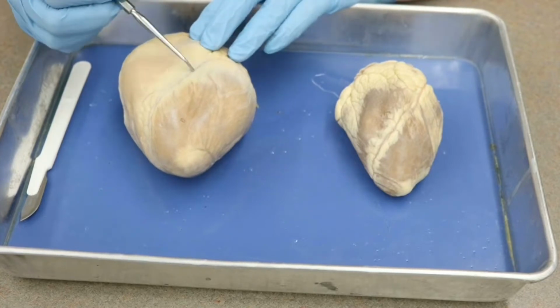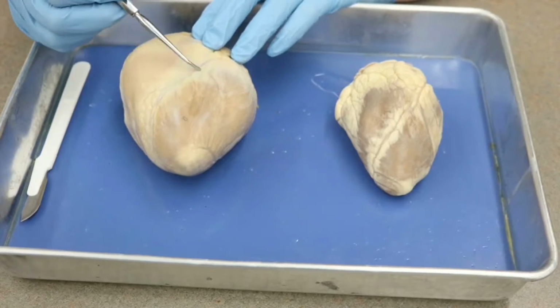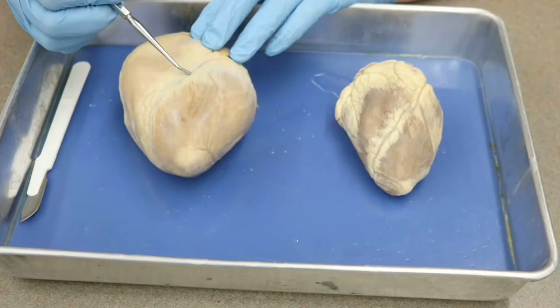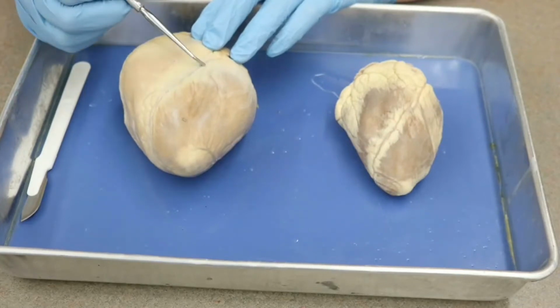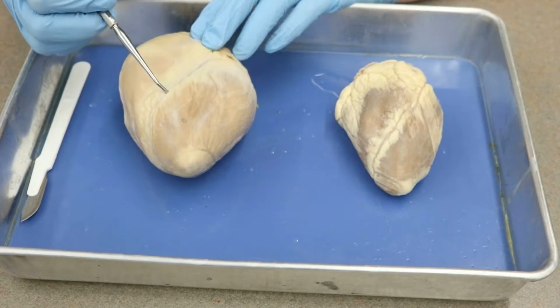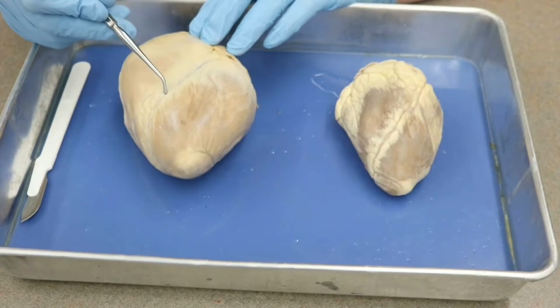We don't really need to know them for the dissected heart, merely because, well, they're not here. On a model, though, you would need to know the anterior interventricular artery and the anterior interventricular vein would be running around in this area. But if you're looking at a dissected specimen, this would just be the sulcus.